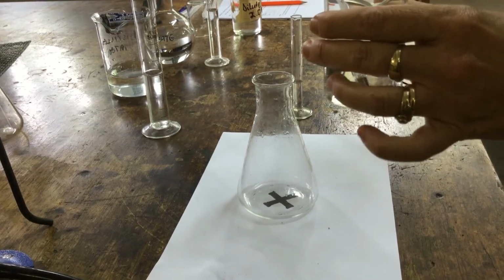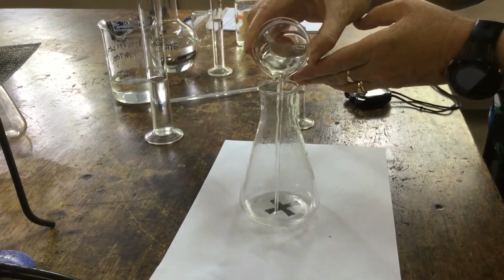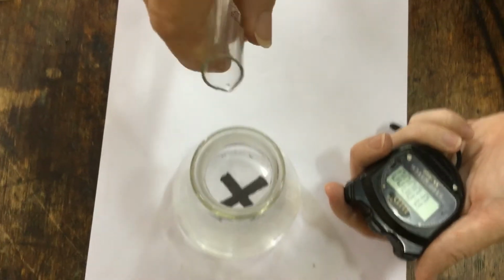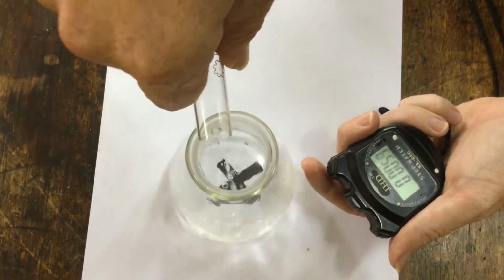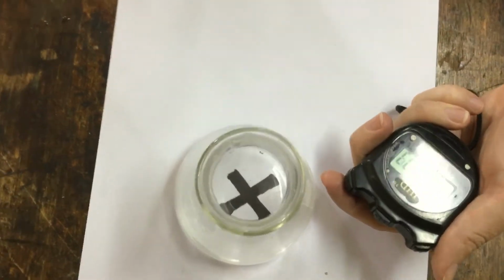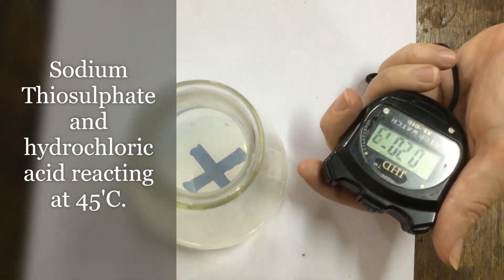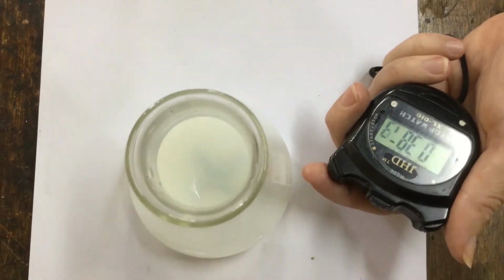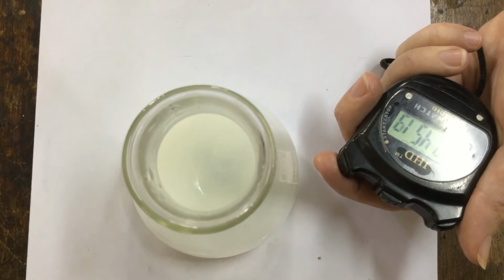Okay, this mixture is now at 45 degrees Celsius. So we're going to pour it in to our reaction flask. We're going to pour in our 5 cubic centimeters of acid and start the stopwatch, and wait for the cross to disappear. Just disappearing. Keep it at about the same point.